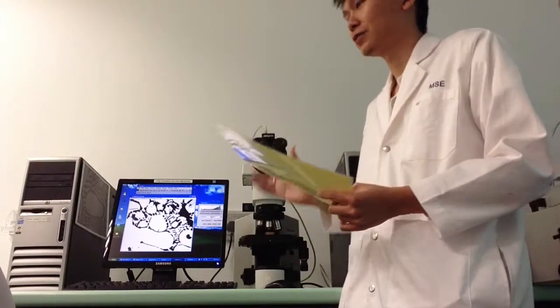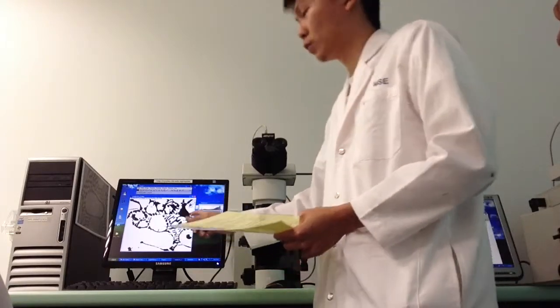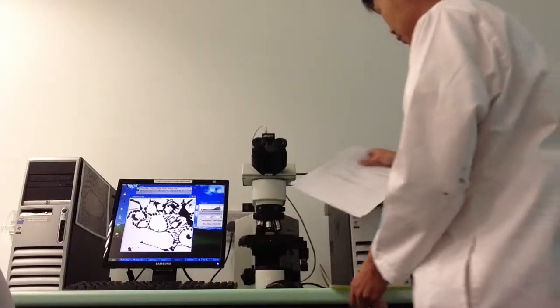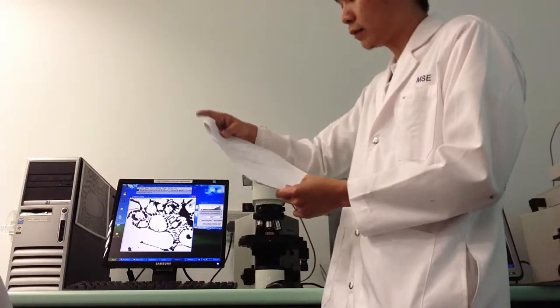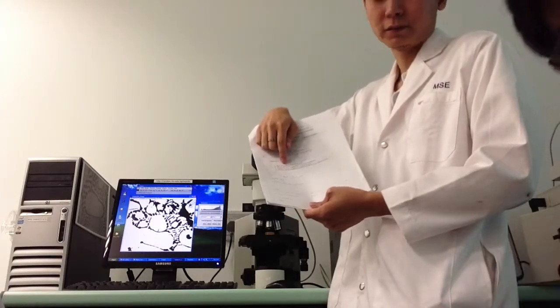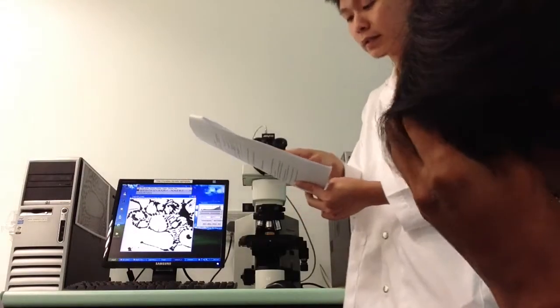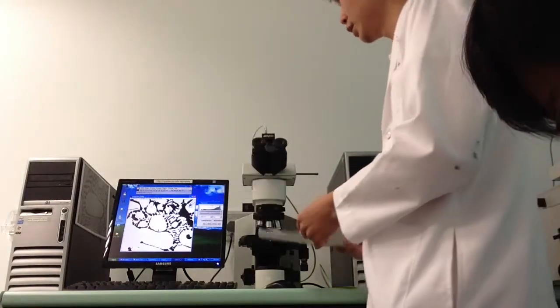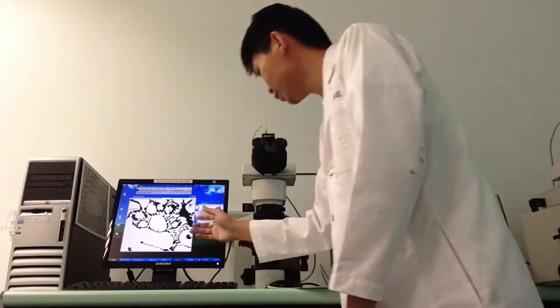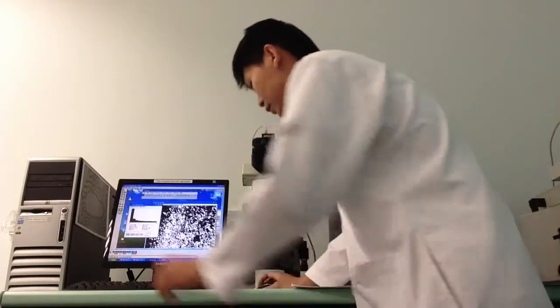Before you do anything, here you have to take a screenshot, because for the Lab 2, you still have to cut out the yellow box. The first question for the Lab 2 is also to insert the selected digital photograph, so it's this yellow box. Just print screen again and save it.